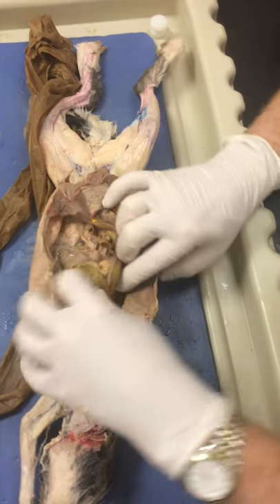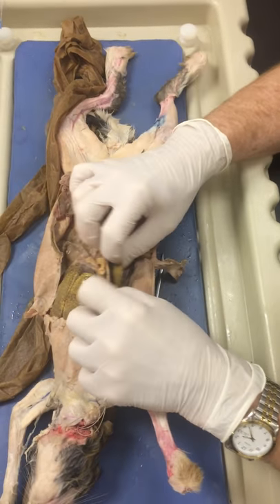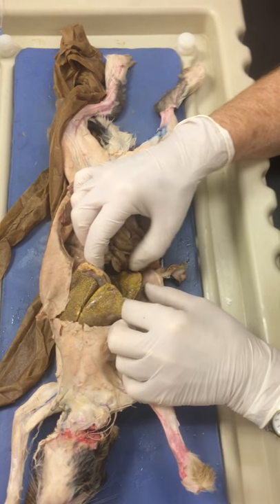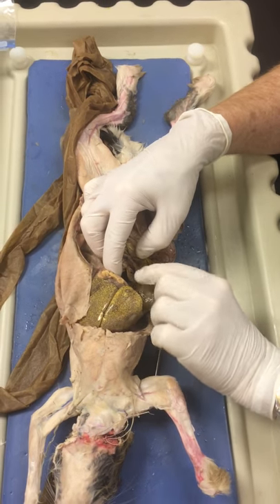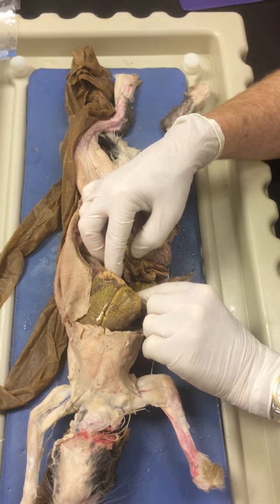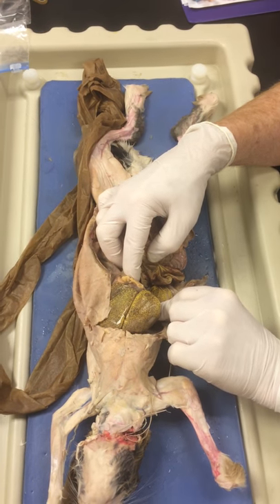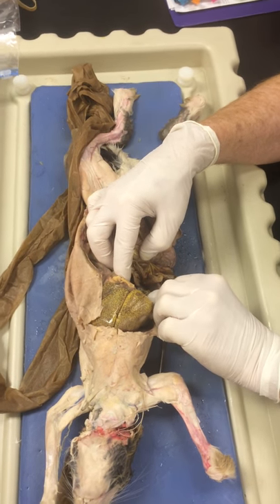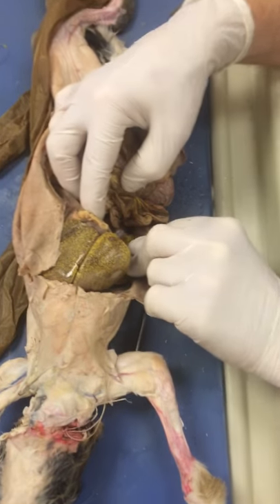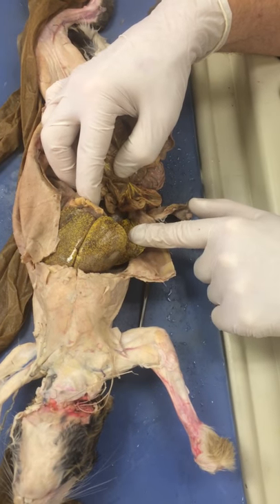Right lateral is down here with the kidney, the outer portion. The more lateral and cranial portion of this is the right medial.